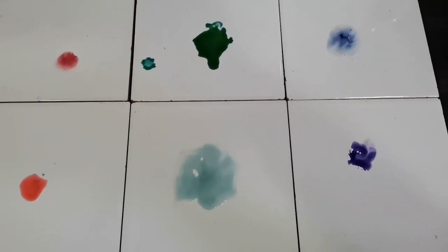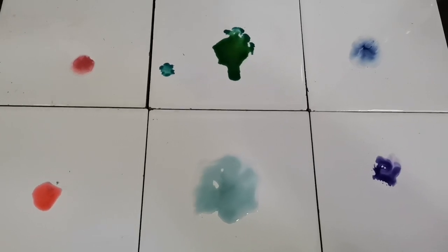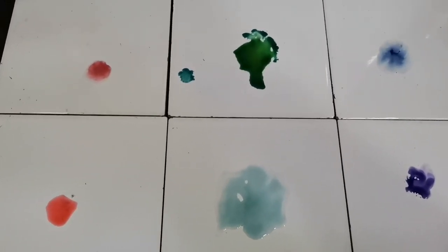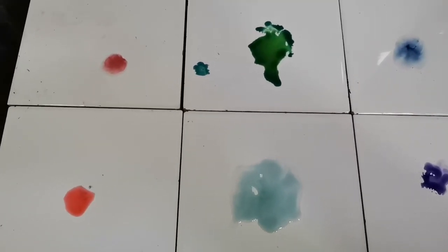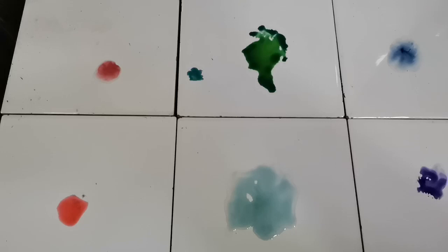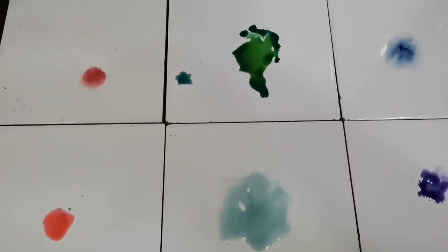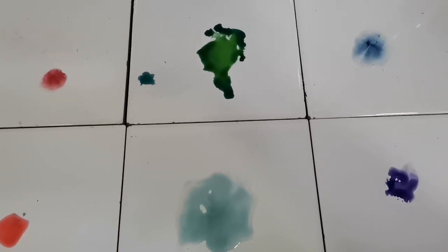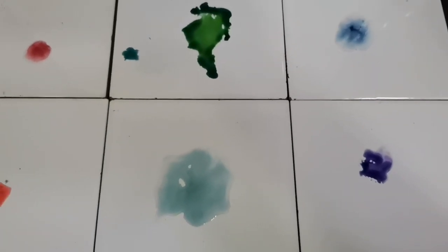So here is an overview of all the color changes that we have just witnessed. Going from top to bottom, left to right. Top left is HCl, bottom left is CH3COOH, top middle is universal indicator on its own, middle bottom is universal indicator in distilled water, right top is universal indicator in NaOH, and right bottom is universal indicator in ammonia.